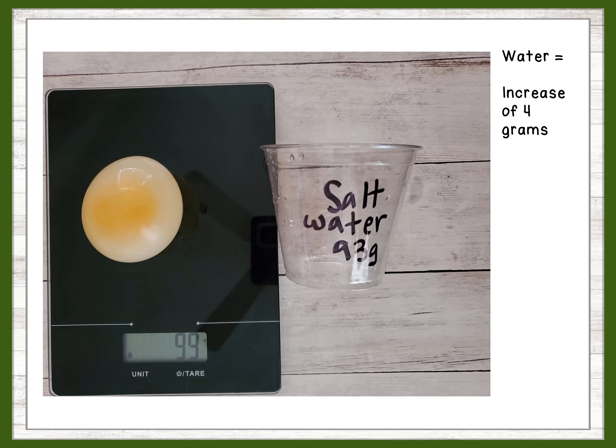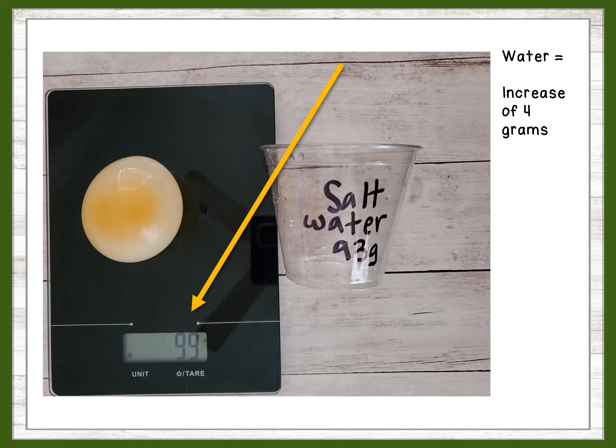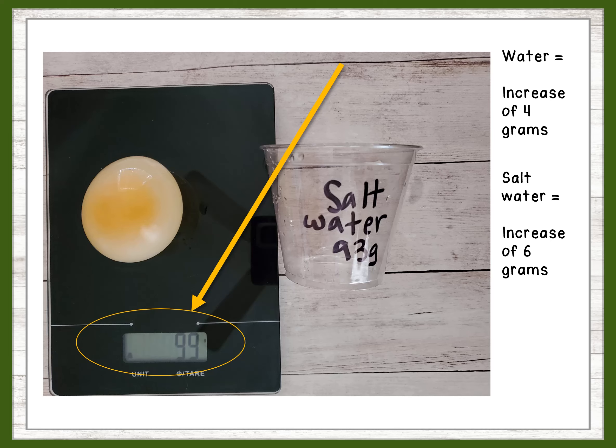Egg two was placed in the salt water solution. The initial mass of this egg was also 93 grams. The final mass, however, was 99 grams — an increase of 6 grams, which is 2 more grams than our control. This indicates that salt water moves more easily across the membrane.